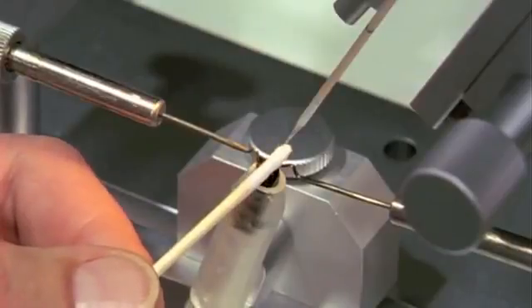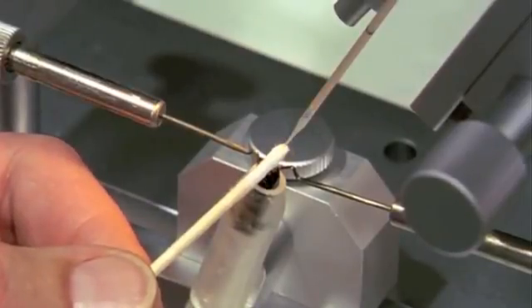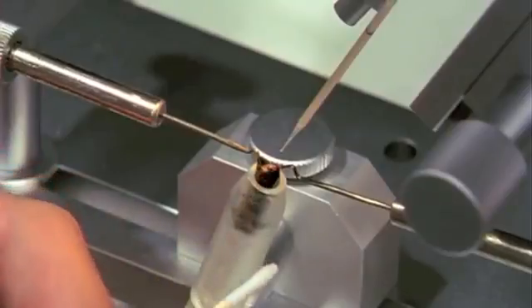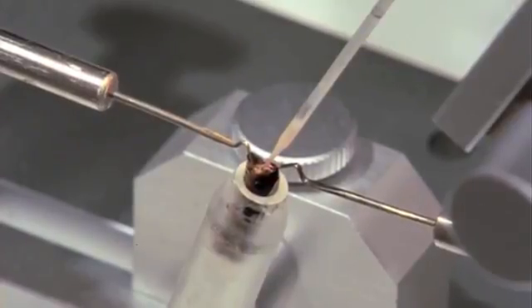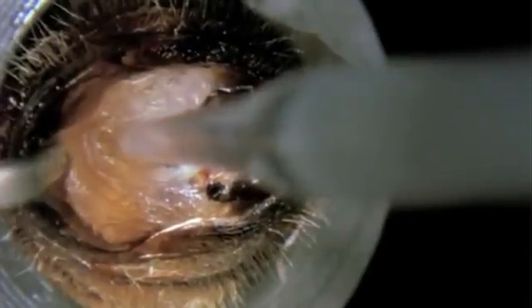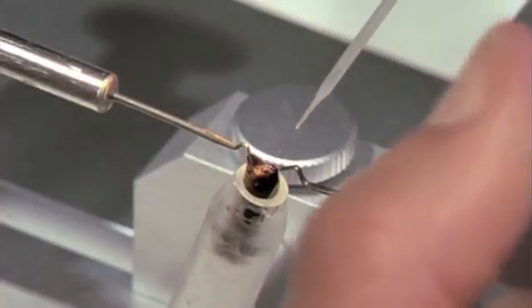The syringe is adjusted in the direction of the vaginal bulge and the droplet of diluent removed. The vaginal orifice is only exposed in techniques which lift up the sting apparatus. The syringe can therefore be inserted without the use of a vaginal probe and the semen is injected directly. This concludes the insemination procedure.